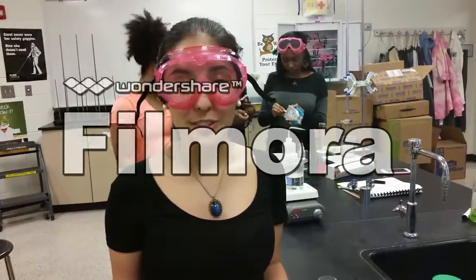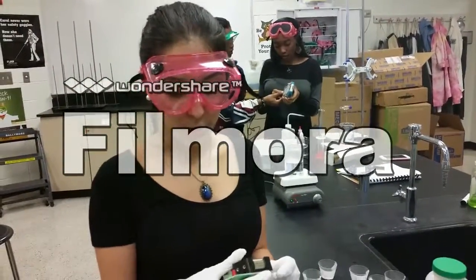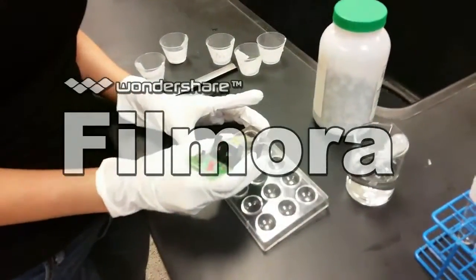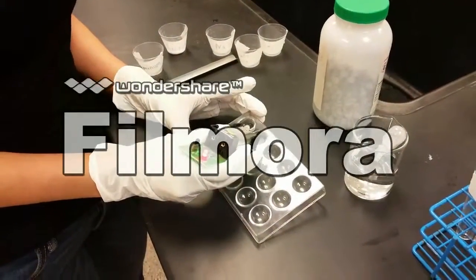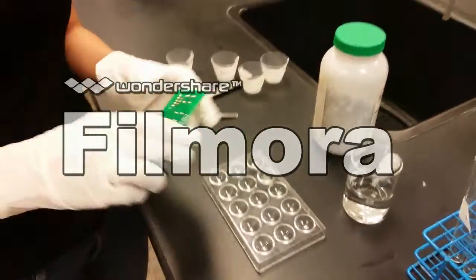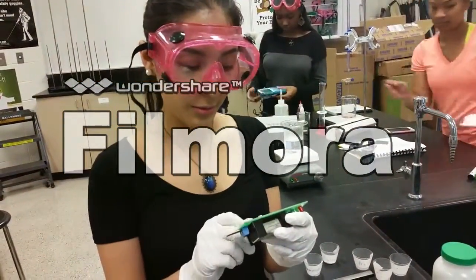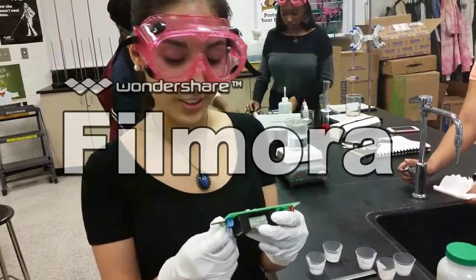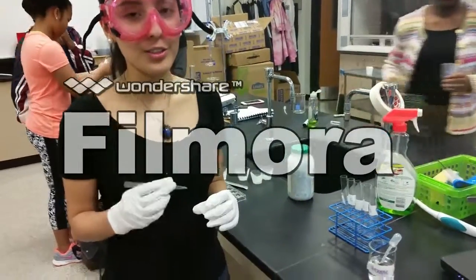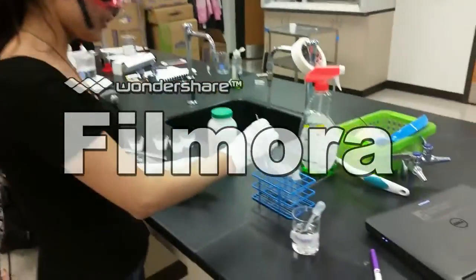If the solid did dissolve in the water, we will test the solution that it made with the water using the conductivity tester again to see if it is now conducting electric current in its aqueous solution. So just tip the reaction plate and place the tips of the conductivity tester into the solution. For that specific solution, we got a bright red light and a dim green light, which meant that the conductivity was high once again.